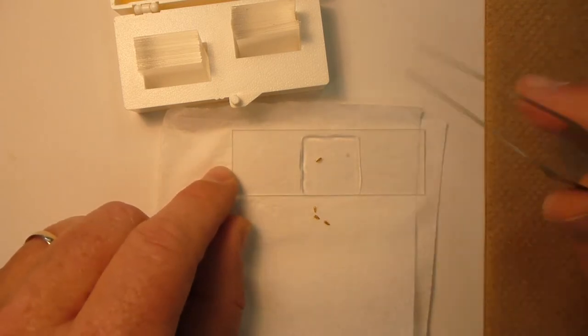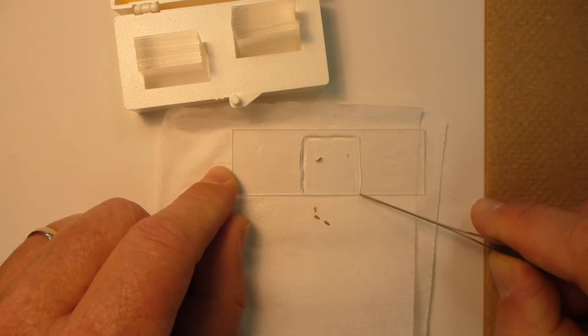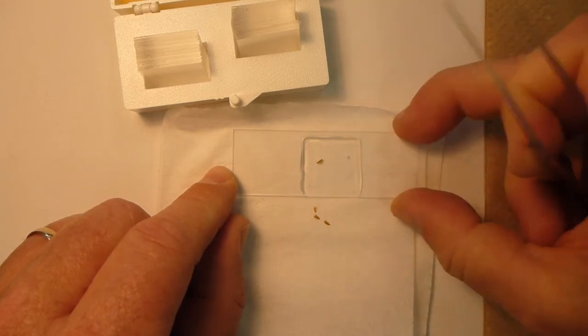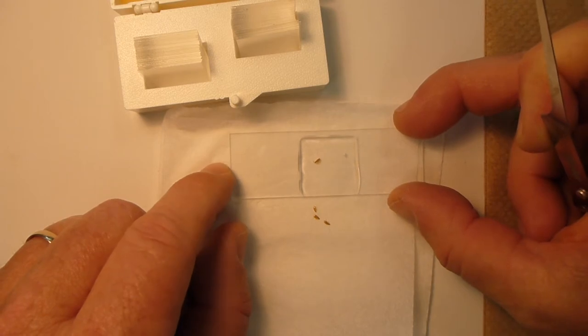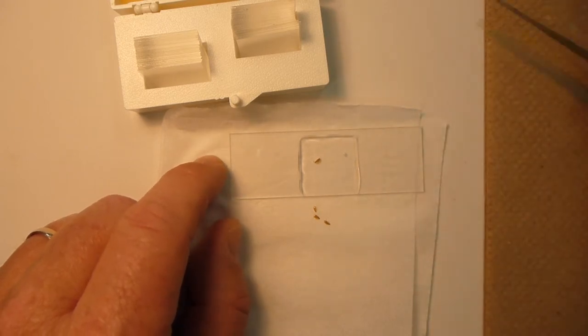Once I have this coverslip now, it will require several days to dry. So just make sure to set this slide in a position somewhere where it's protected, isn't going to get disturbed, and can dry for several days.